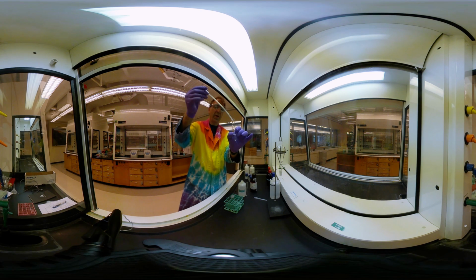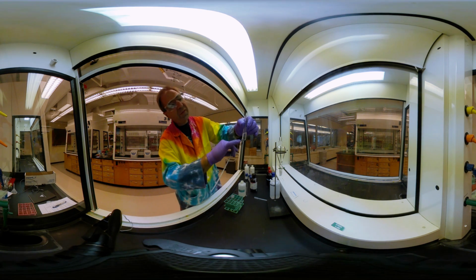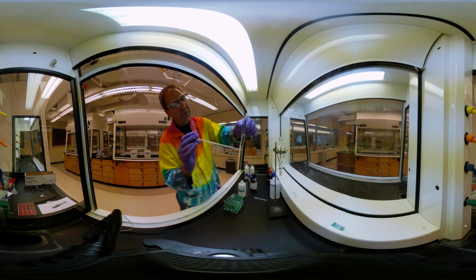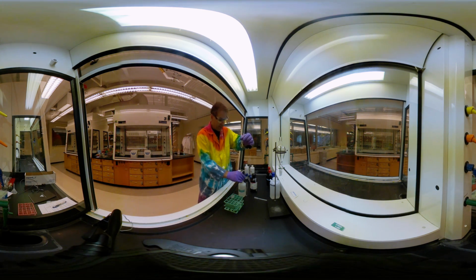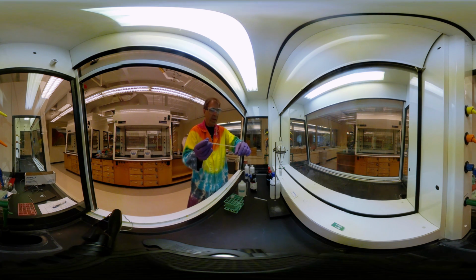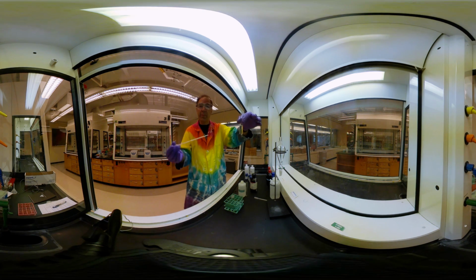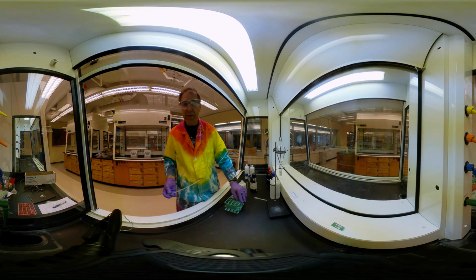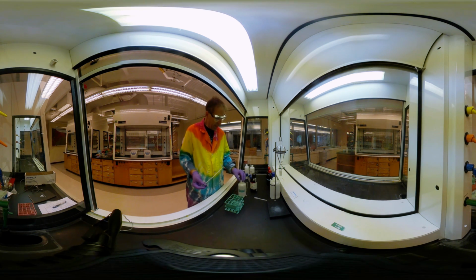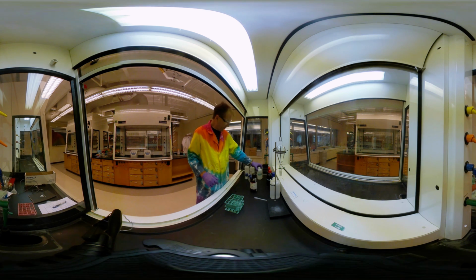So we definitely have 2 layers again, and I hope you can see that on camera. I'll check that a little bit later on, but there's a 2-layer line right there. Hopefully you saw as I put it in that the NaOH was going to the bottom. Part of the way you can see that is the bottom layer expanding as I put even more in. So with base, it doesn't seem to have affected that solubility. We still find that hexane's the top layer, and we get 2 different layers.